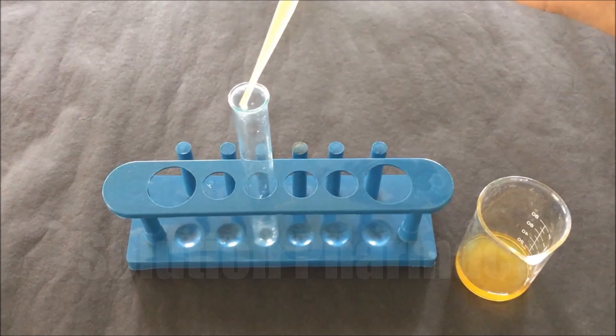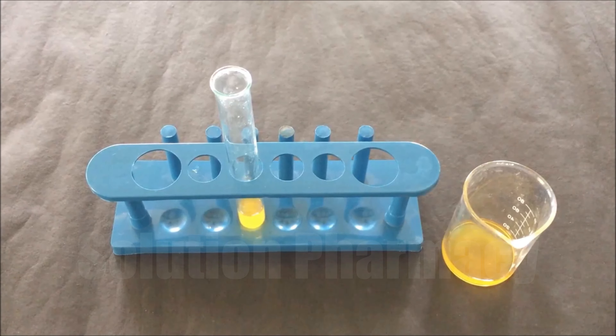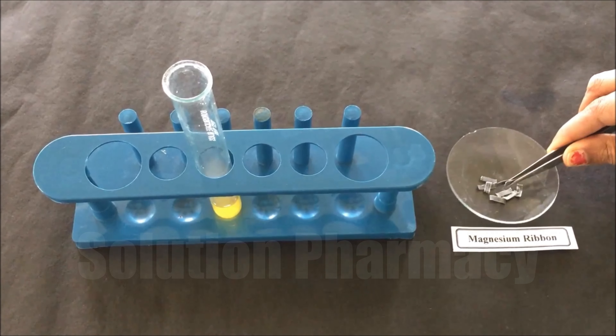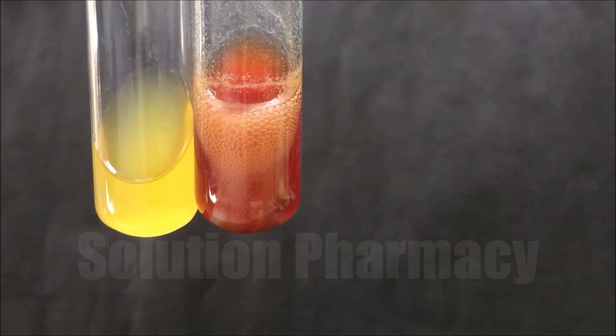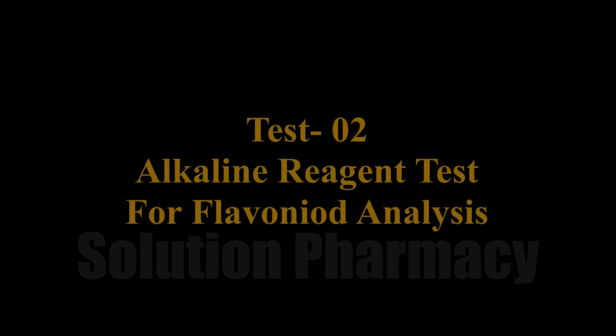Take about 2 to 3 ml of the ethanolic extract of orange peel powder and transfer into a test tube. Add a few drops of concentrated HCl — about 3 to 4 drops — into the test tube. Then add about 3 to 4 pieces of magnesium ribbon. After the addition of concentrated HCl and magnesium ribbon, if the color of the extract changes to orange, red, pink, or purple, it indicates that flavonoid is present. Here the color changes to red, confirming flavonoid is present. The principle is that flavonoid gets reduced to anthocyanidine, causing the color change to red.